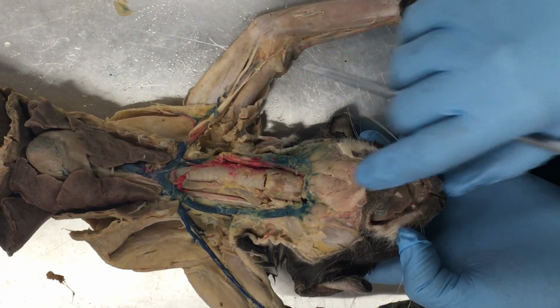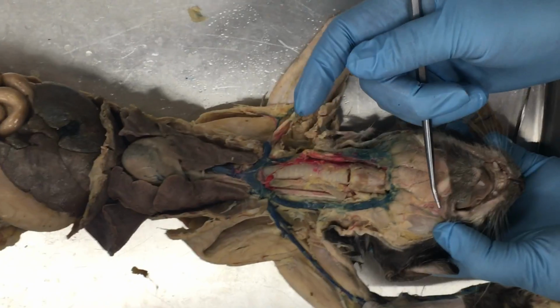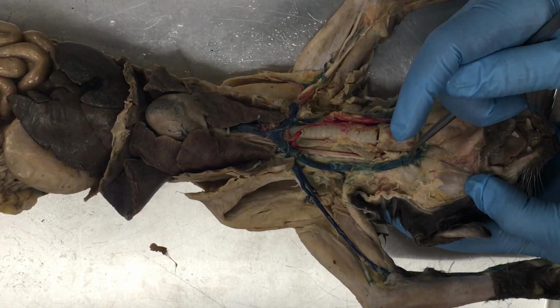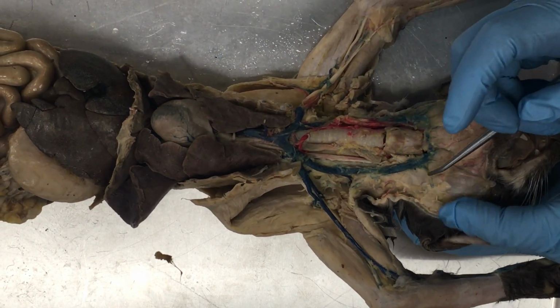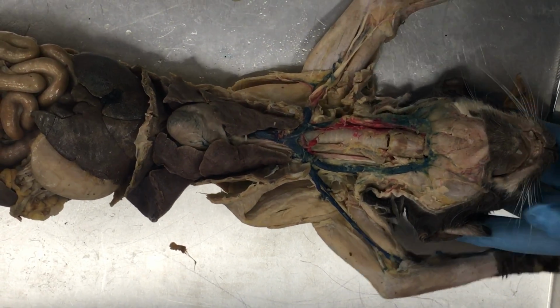There's another salivary gland, our submandibular salivary gland. Remember, mandible is the jawbone, so we just kind of follow it out. We get this mushy salivary gland right next to our jugular. This is our submandibular. And they're next to each other. They have a pretty different look to one another, though.